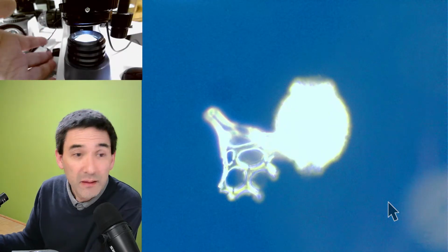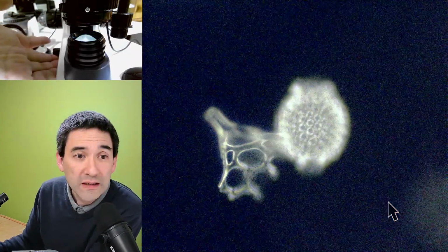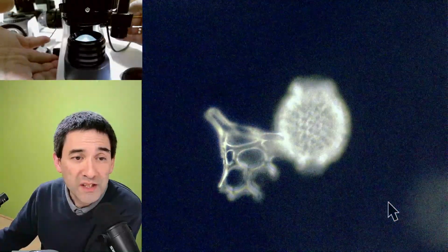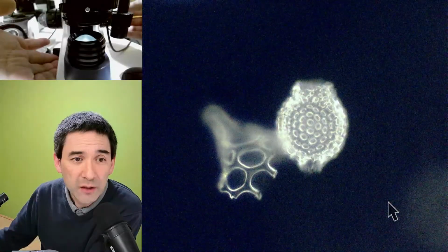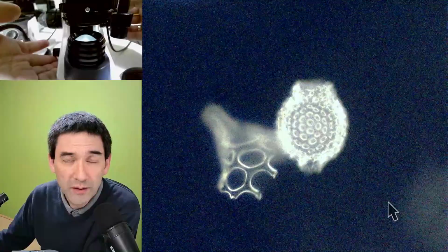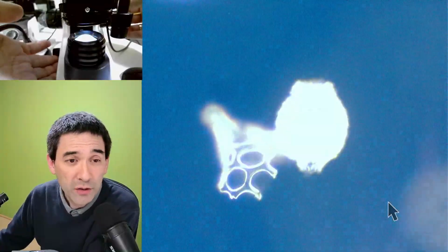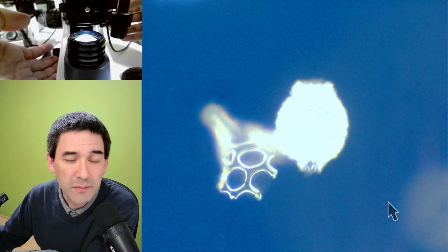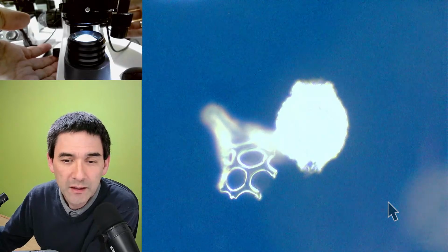And that's so-called dark field, or Rheinberg again. Unfortunately, it's a little bit too bright. The reason why it's so overexposed is because the camera tries to adjust. I'm turning down the light now a lot. But if you look actually through the microscope eyepieces, then it looks quite nice. Over here, because of the limited dynamic range of the camera, the specimen now looks completely washed out.